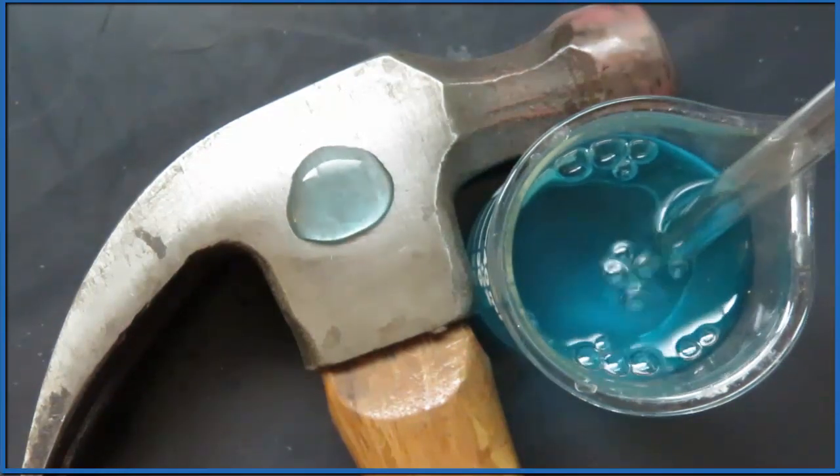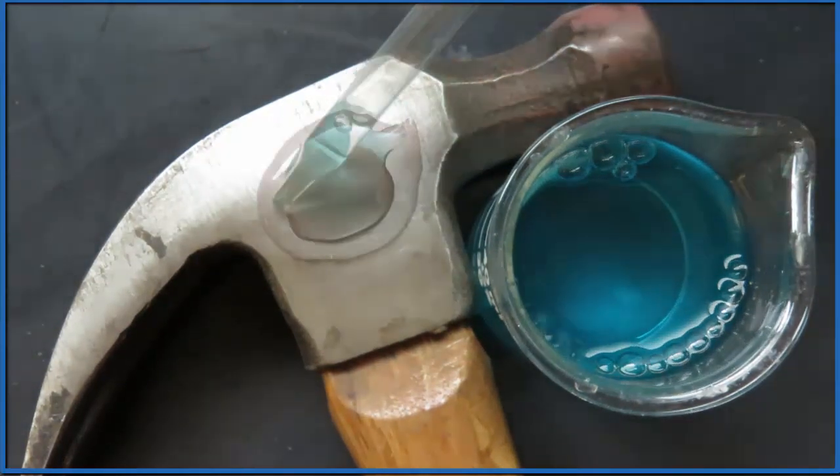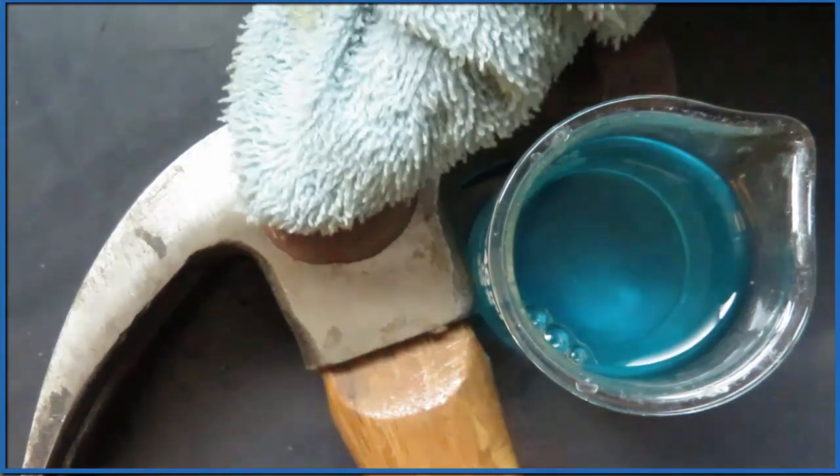We let it react for just a second and then when we wipe it off, you see that copper there? That was the blue color, but now it's on the hammer.